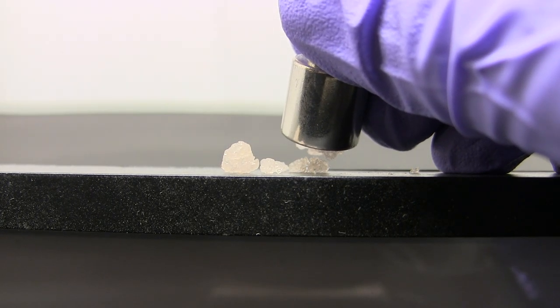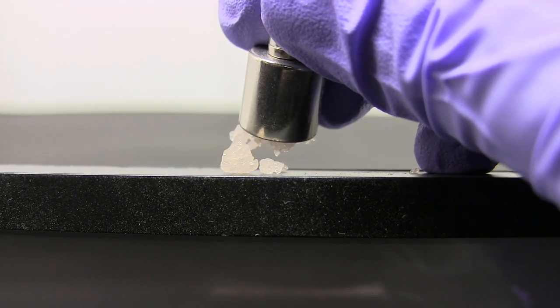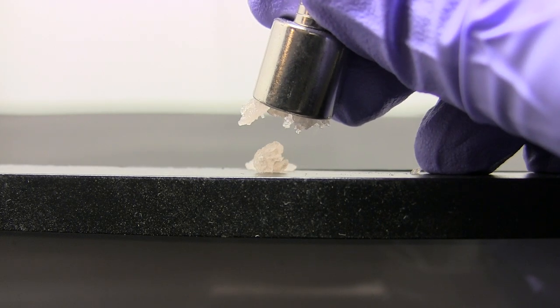This effect also works for other manganese 2 salts like manganese chloride or manganese sulfate. Transparent ferromagnetic substances do exist but are hard to come by.